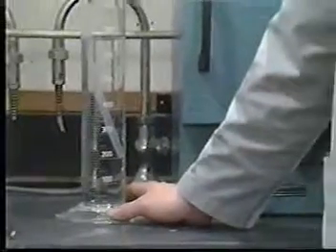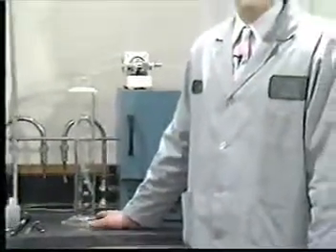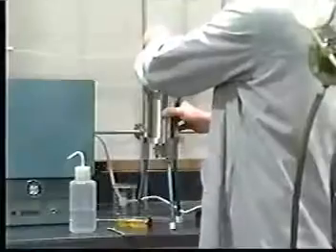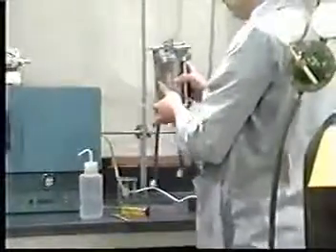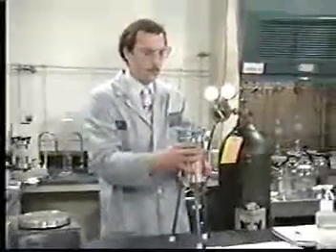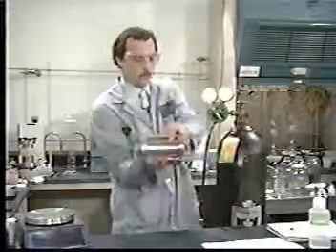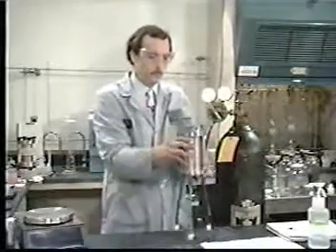The fluid is being drawn from a graduated cylinder reservoir to accurately determine when the right amount has been added. Various other fluid transfer techniques are allowed, including the use of a second ZHE. When the correct amount of fluid has been transferred to the ZHE, check that all valves are closed and disconnect the fluid transfer line. Rotate the ZHE end over end 2 to 3 times to trap any gas remaining in the device at the top.